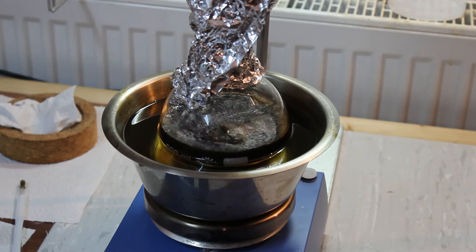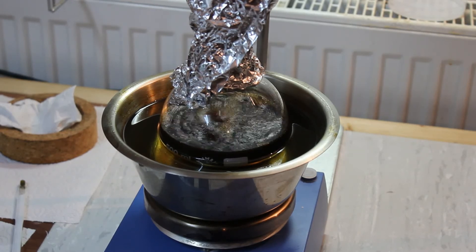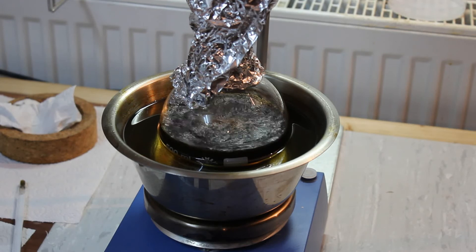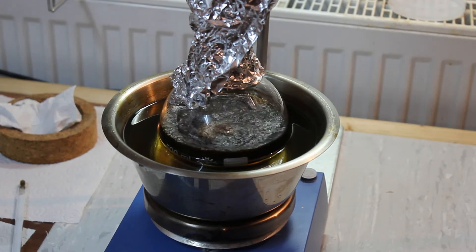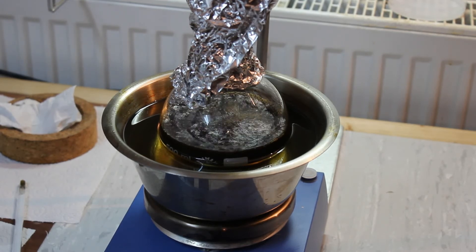Since the reaction is going so well I thought I might as well add another 100 milliliters to the addition funnel. So the total amount of ethanol is 500 milliliters now.